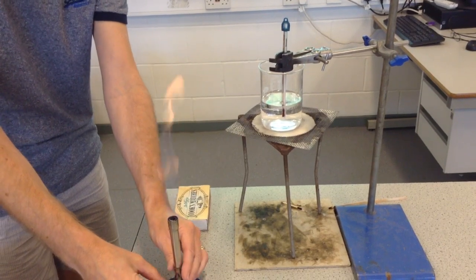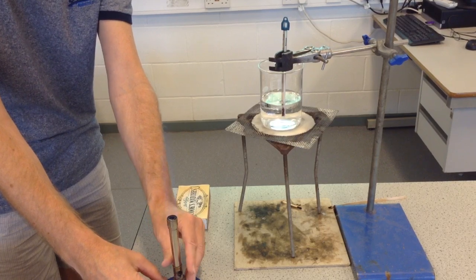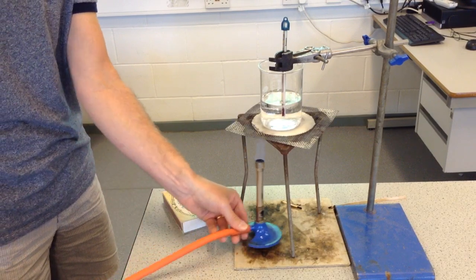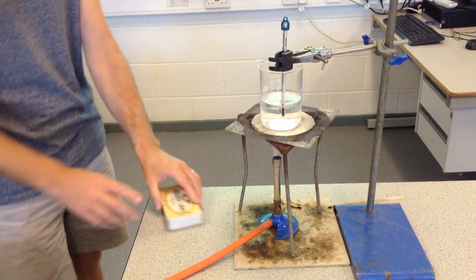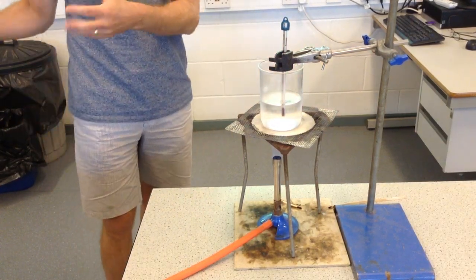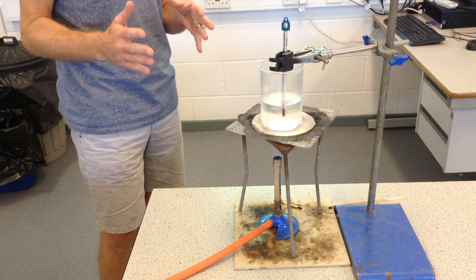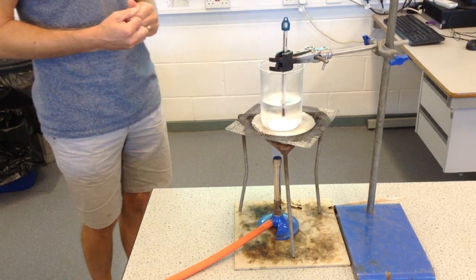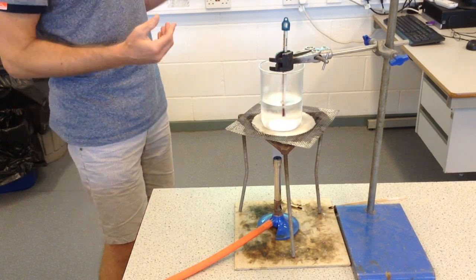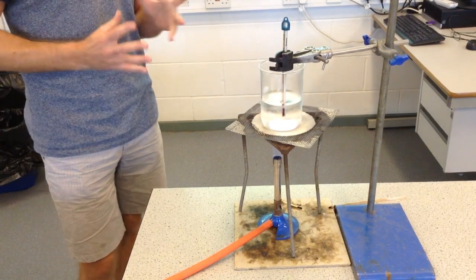I'm going to turn the collar so that the Bunsen is on a gentle blue flame to begin with — I don't want to go straight to a roaring blue. I've got my stop clock ready and we'll start the time. At this point I need to keep an eye on the experiment. I don't want to turn and have a chat with my friends. I need to just watch to make sure nothing's going to go wrong, keeping my distance for safety. When one minute is up I can read the thermometer and put the next temperature in.